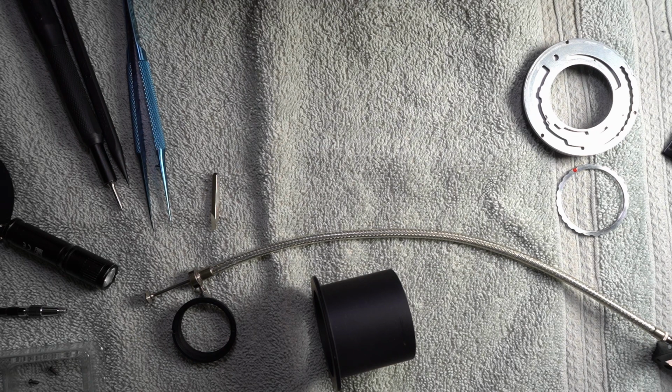I don't want to overdo this because I don't want there to be excess that gets on something, but I'm like 90% sure that this is too thick to really run, unless it gets really hot or something for whatever reason. And I don't know why it would.